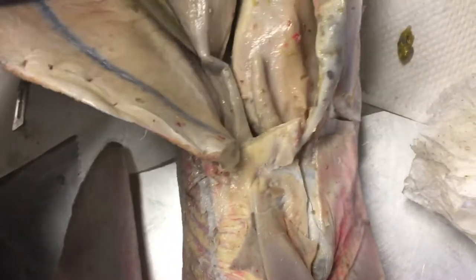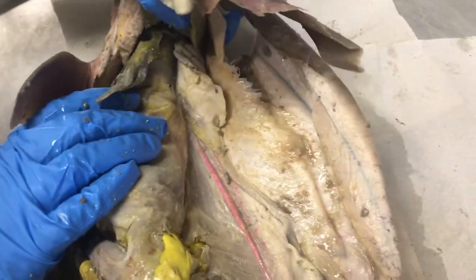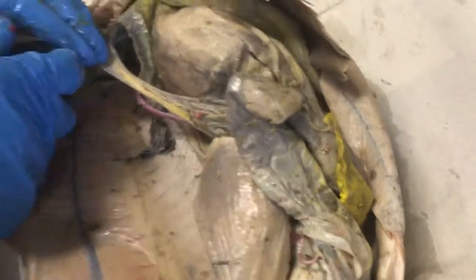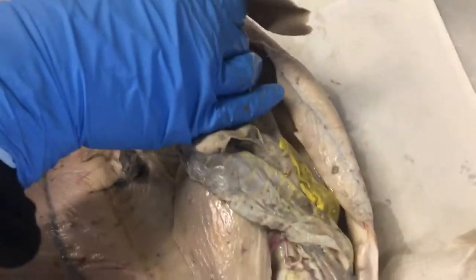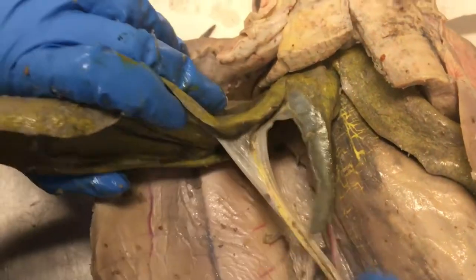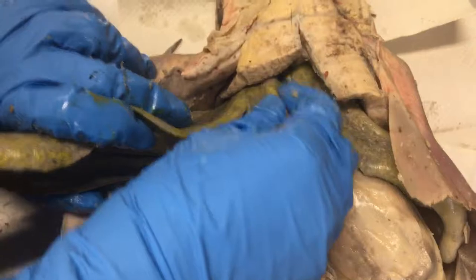The gallbladder will typically discolor, so it usually is a darker color. It might be this greenish part right here — that's what I think the gallbladder is, because it's usually right next to the medial liver. Here's the medial liver — that yellow, fatty part — and then the gallbladder is this section.